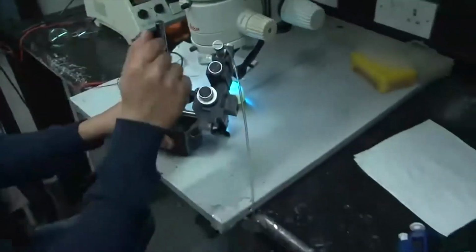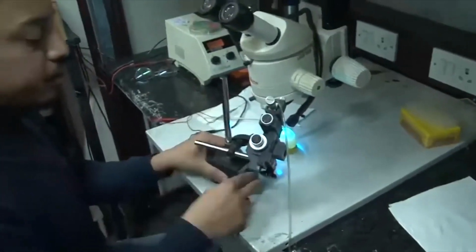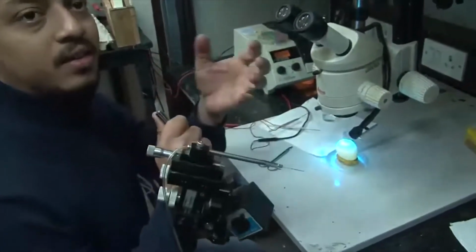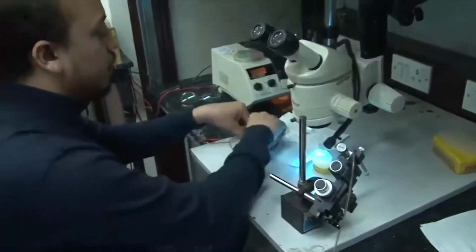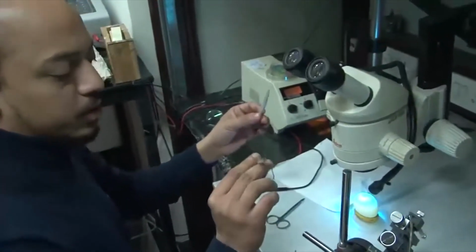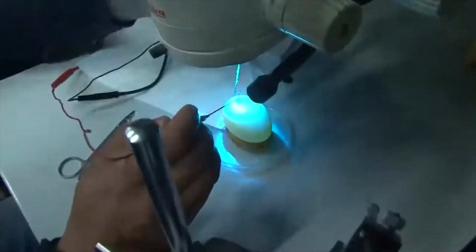there's a pressure going into the pneumatic pump which forces DNA into the tissue. We have a dye, as you had seen earlier, a blue dye which we use so that we can see if the DNA is getting into the embryo properly or not. And then when it's finally done, we have two electrodes here, and we direct the DNA towards the positive end because DNA is negatively charged, and from the other end we place it just at the bottom of the yolk.